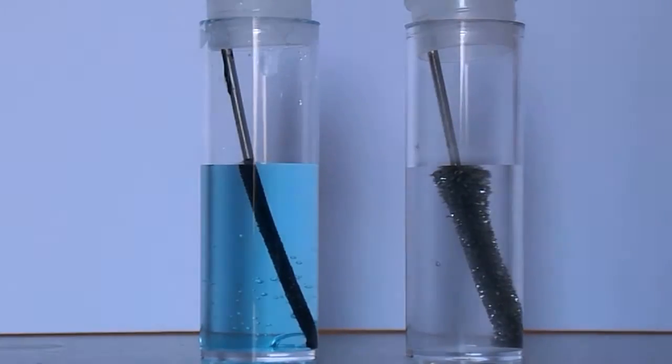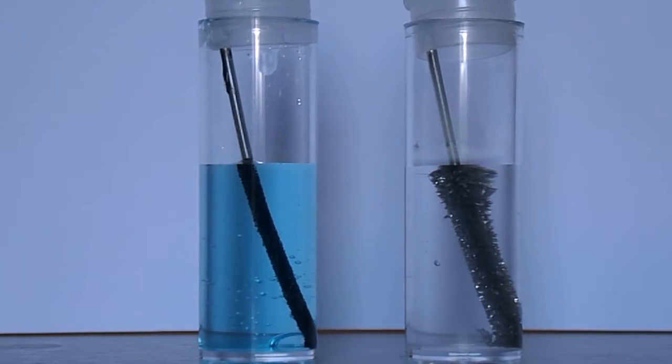You can see that the zinc reacted to the blue copper sulfate solution on the left to produce a thin layer of metallic copper on the zinc rods.